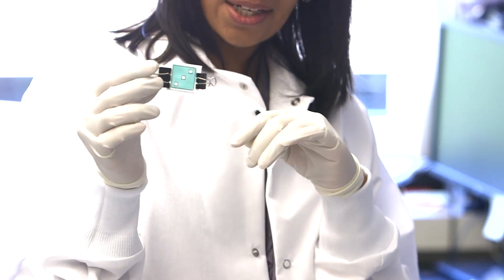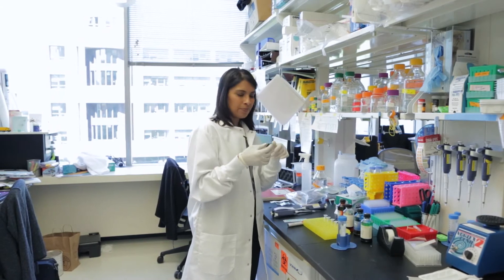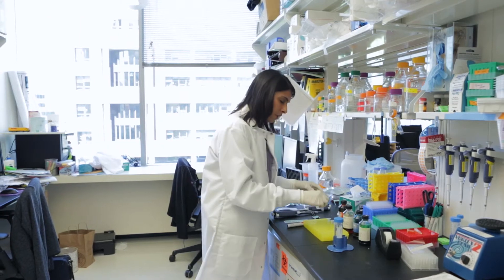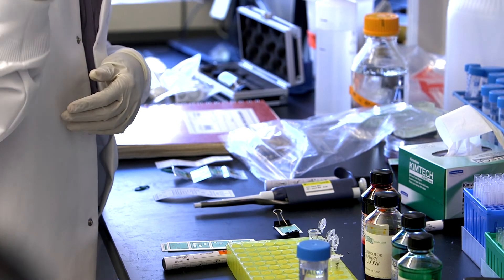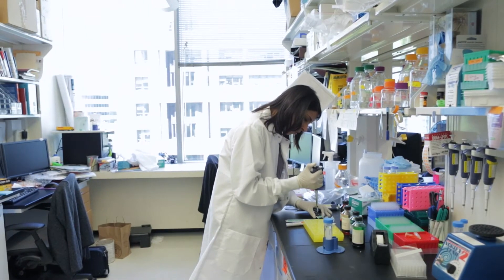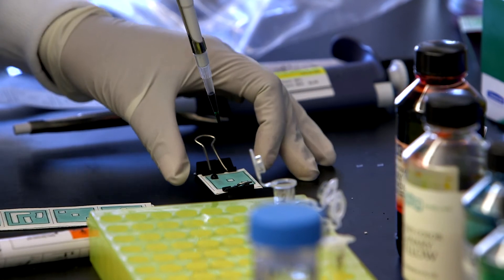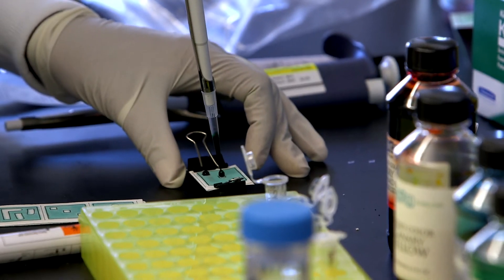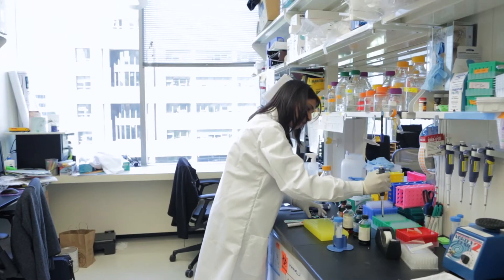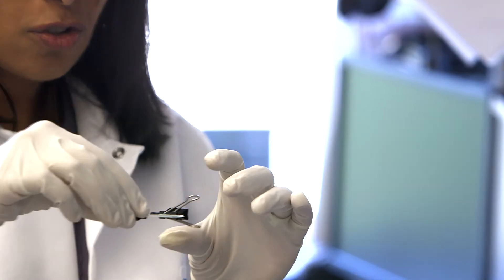Now I have this structure on one side, and a couple of intermediate patterns that should network the fluid to this side. Here in these test tubes I have just simple different colors of food coloring. What I'll do is take a pipetter and just apply a different color to each square. This is the green. Now we wait.